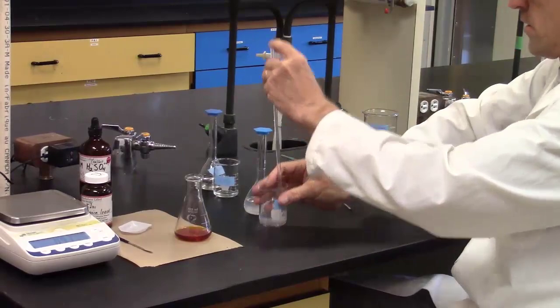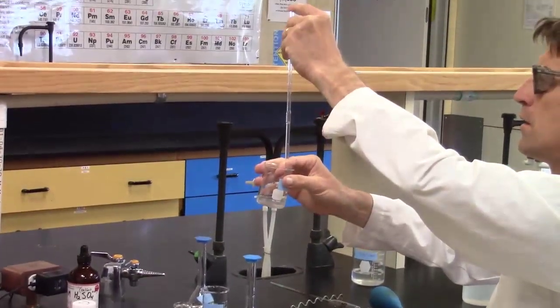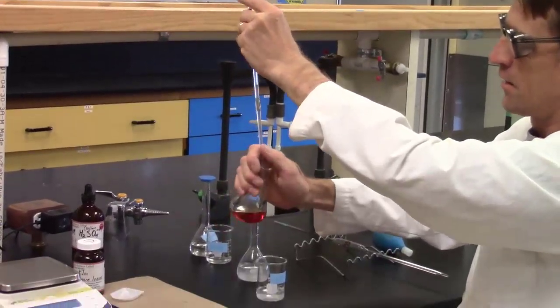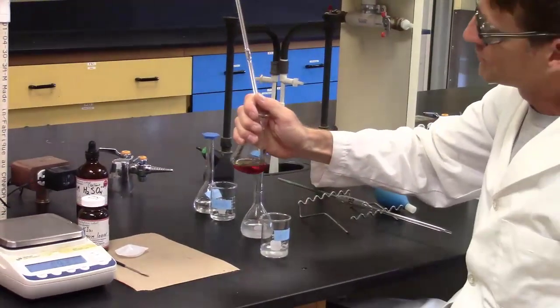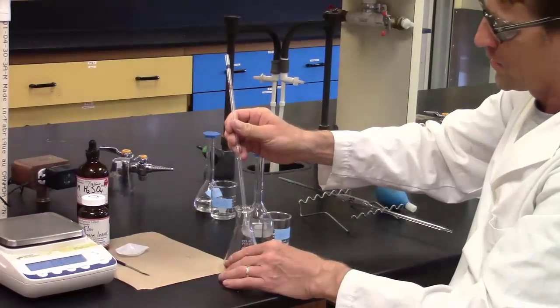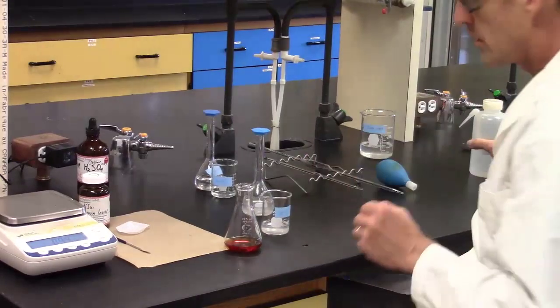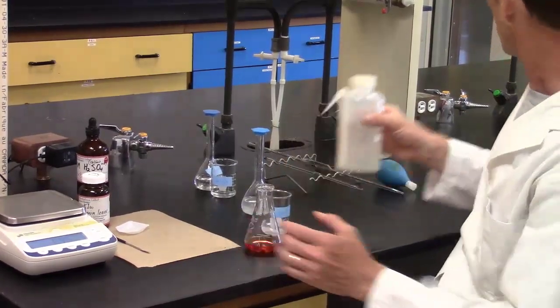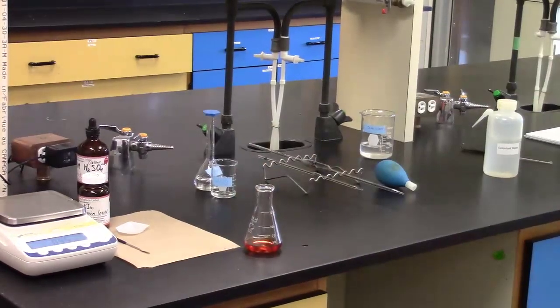While it's difficult to pick out in a video presentation, there is a slight fading of the orange-brown color when Scott pipettes the 1 ml of the vitamin C solution into the Erlenmeyer. This is, of course, due to the fact that the vitamin C reacts with the iodine. Prior to starting the titration, Scott rinses the sides of the Erlenmeyer to ensure that all the reagents are combined.